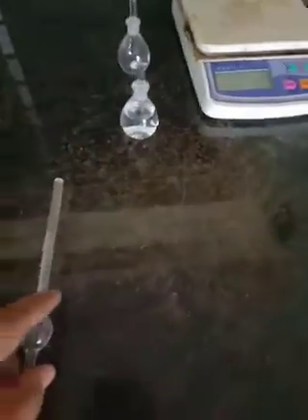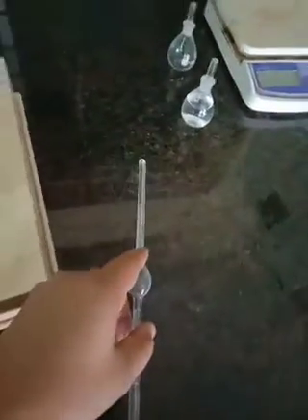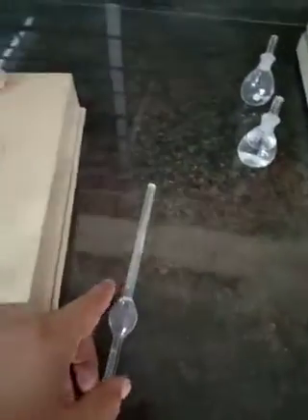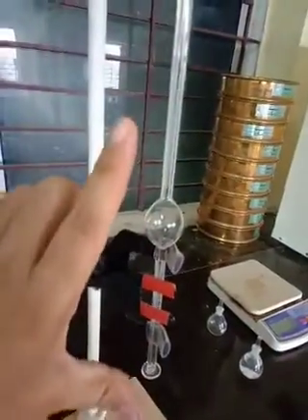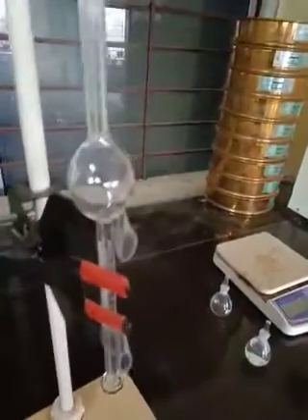The stalagmometer must be mounted in a vertical plane within a clamp. We attach it vertically here and put it in the vertical position securely.